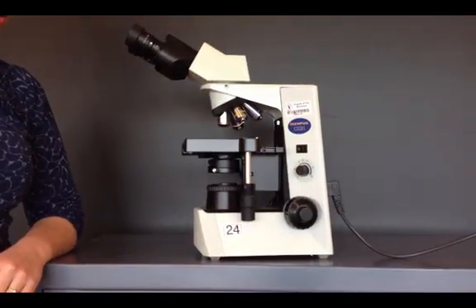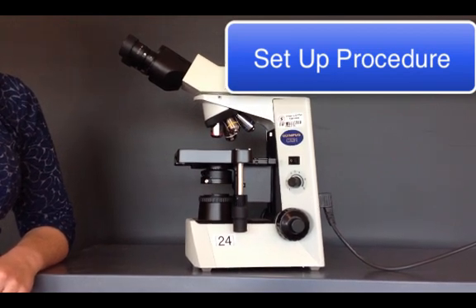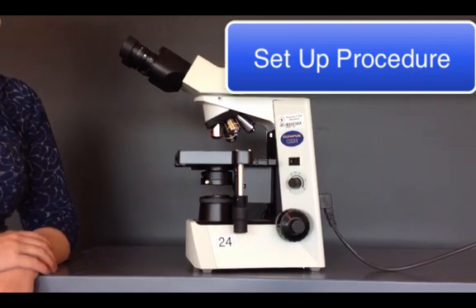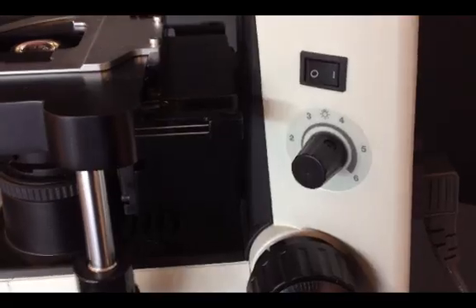Once you have your microscope plugged in, you're ready to set it up before you turn it on. You do not want to turn it on if it's not set up, especially if the rheostat is turned all the way up high on say 5.